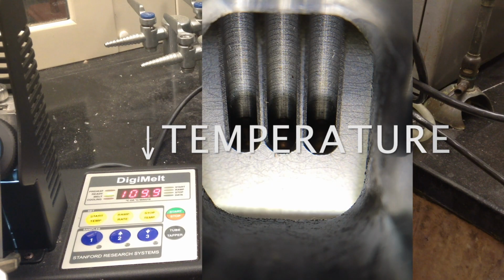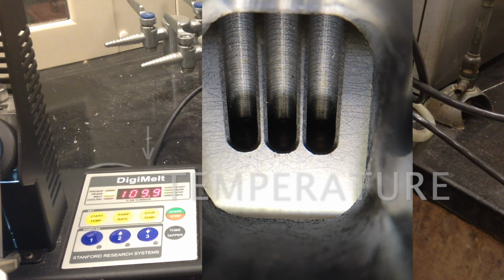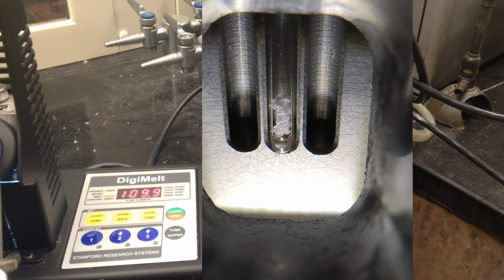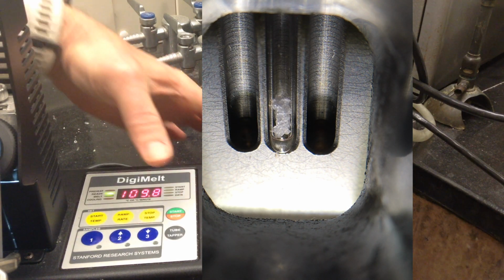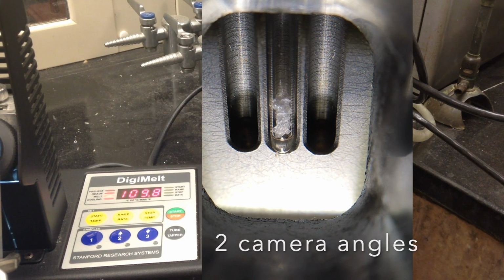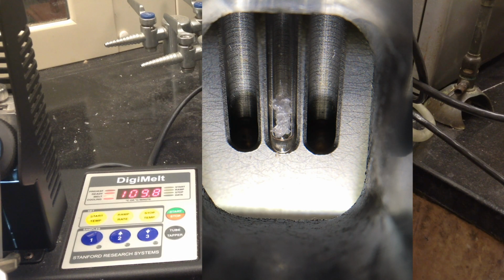So we have the temperature preheated to about 110 degrees. And we're going to slip in the maleic acid. And I'm going to start the button. And so it's going to ramp up at about 10 degrees a minute, so about every 6 seconds the temperature will increase 1 degree, and so we're just going to let it ramp up. Again, the melting is expected in the range of about 137 to 140. Right, so we want to watch this and watch it melt.